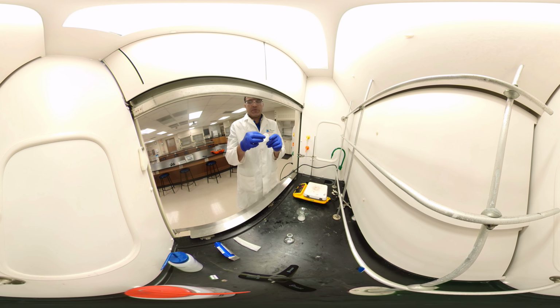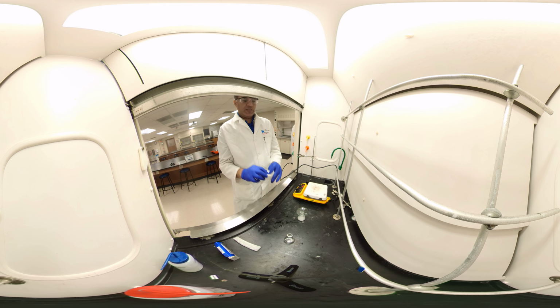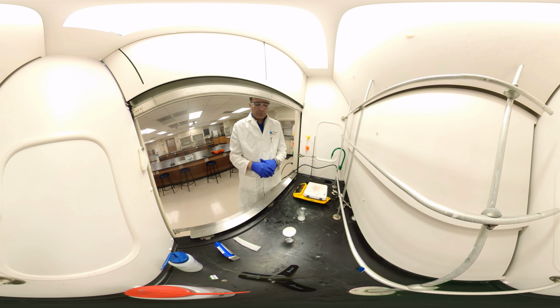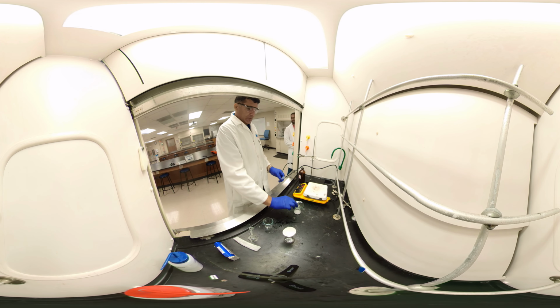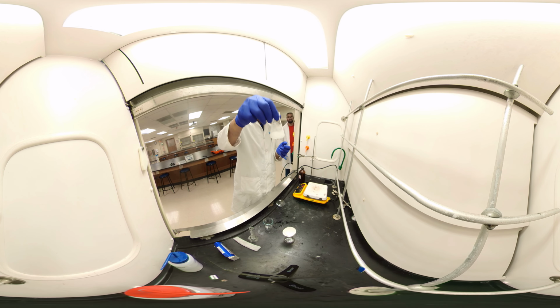And I have the filter paper funnel ready to filter. The solution we dissolved before, we add it. 2 components dissolved, 2 are solid. Now I have that Goody's powder dissolved, but you see some solid here.